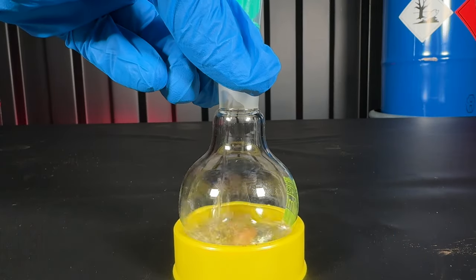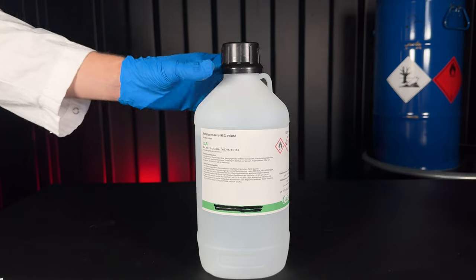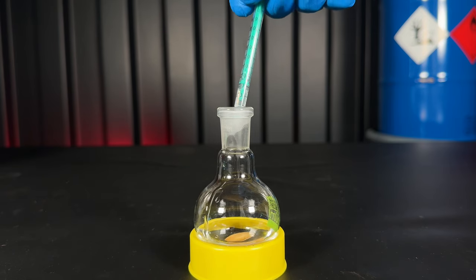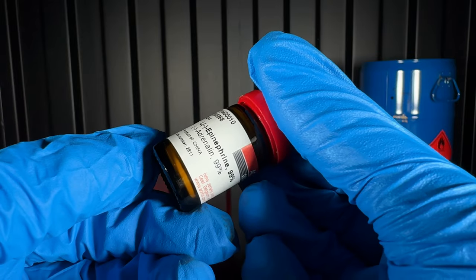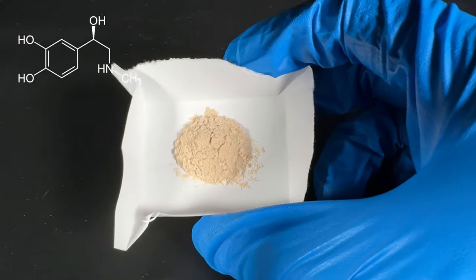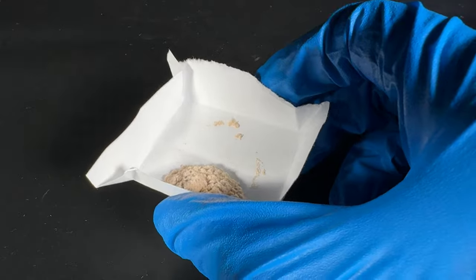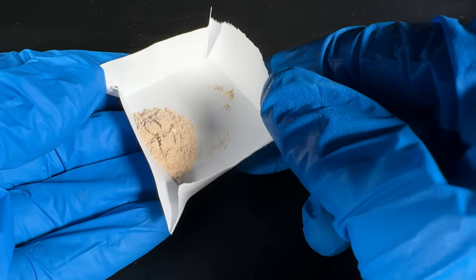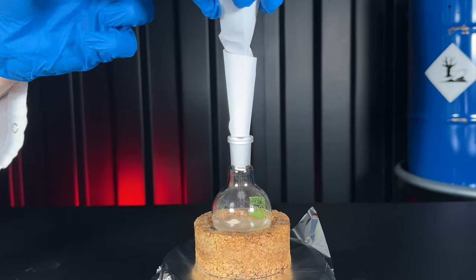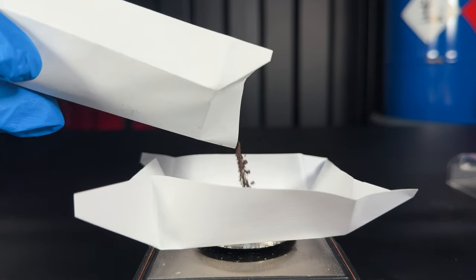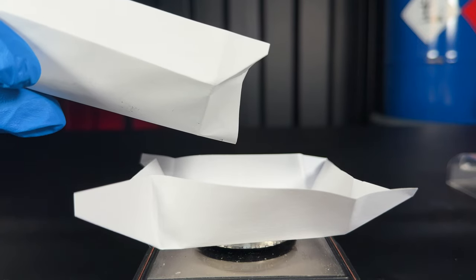I added 14 ml of methanol to this round bottom flask. And then I added 0.27 ml of 99% formic acid. And instead of the blood of tortured children, I'm going to use adrenaline. The only true part about the adrenochrome myth is likely that being tortured actually increases the adrenaline release in your body. I added the adrenaline to the methanol solution and then weighed out 2 grams of the expensive dirt I made earlier.